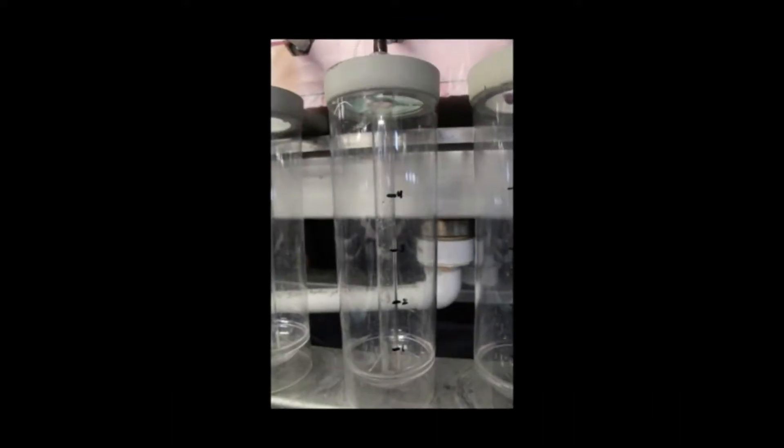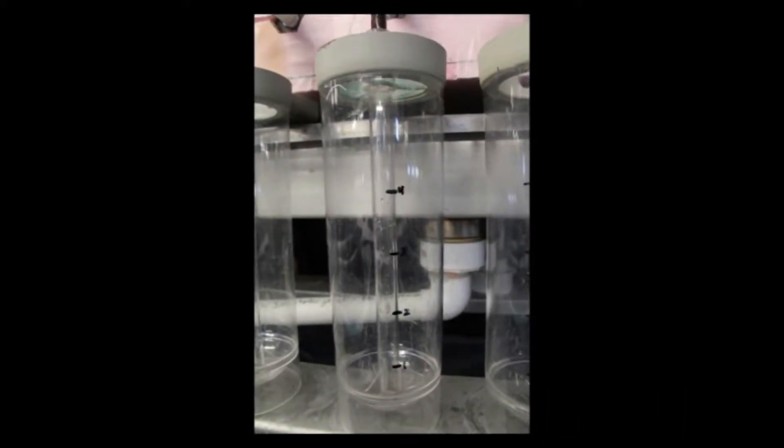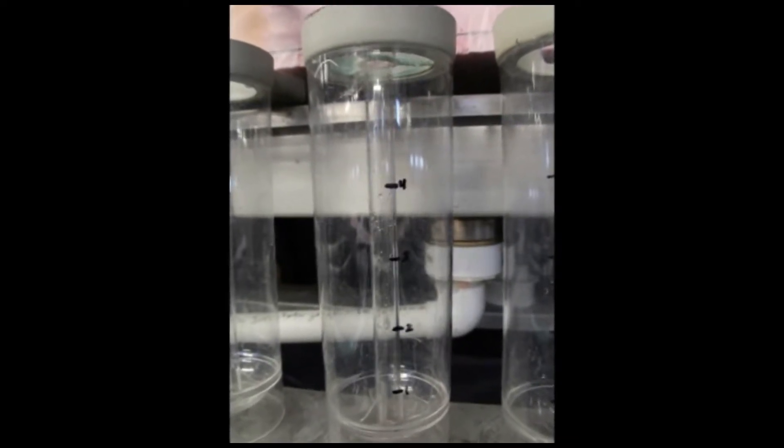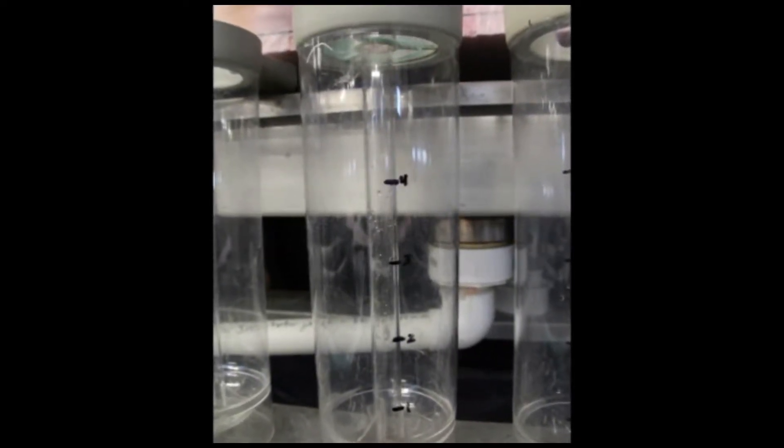It is also a good idea to mark a volumetric measurement on the bell jars before use in order to determine an approximate total volume of eggs at any time during incubation.